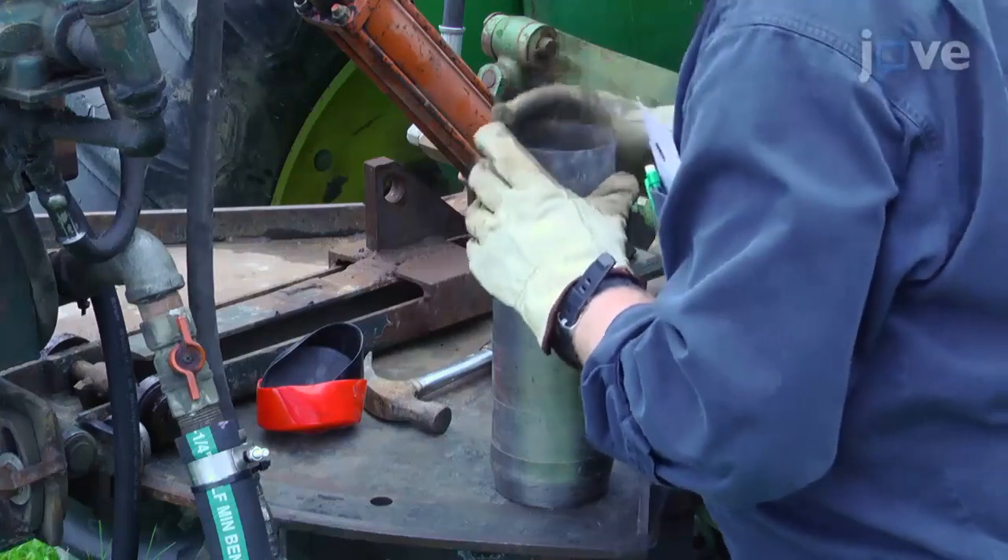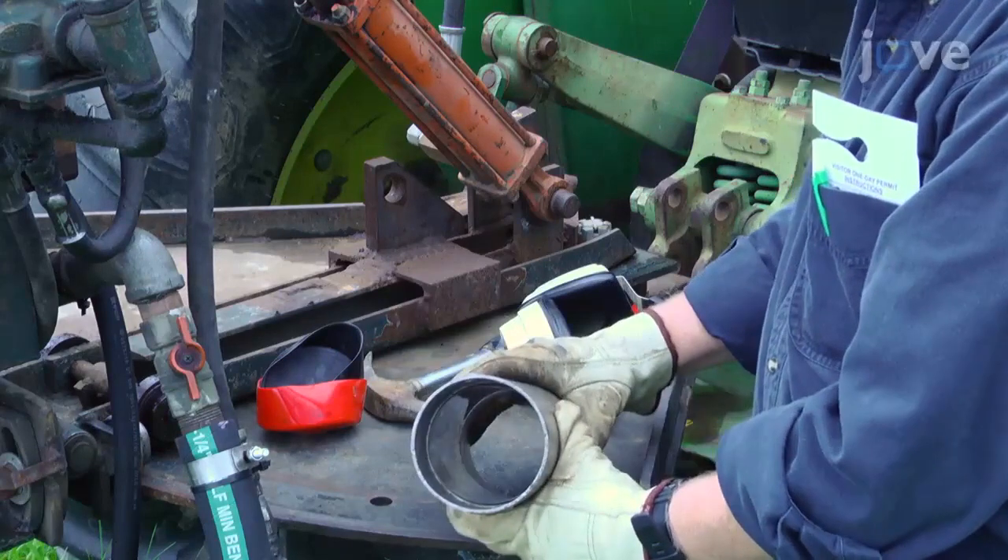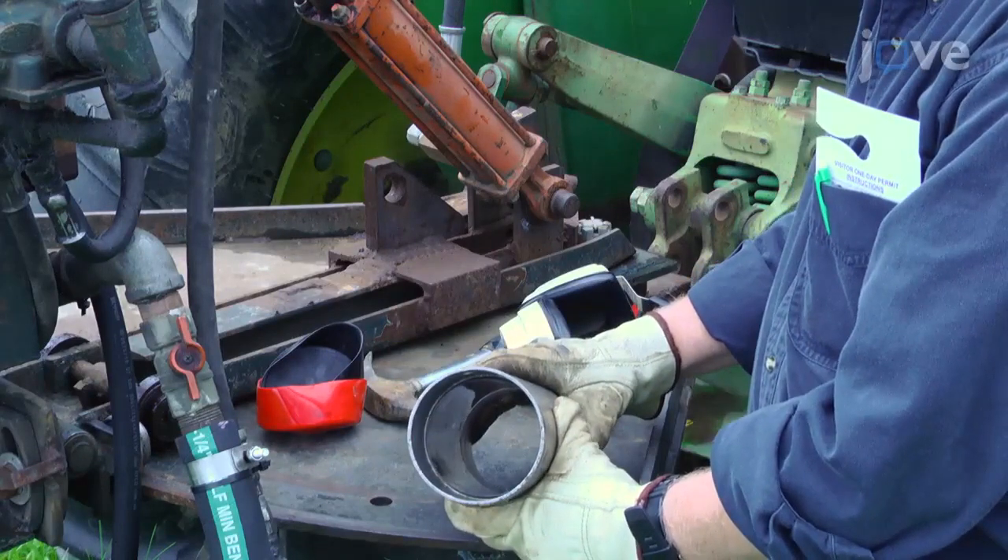For the application described here, use a 150 mm long plastic liner with a 90 mm outside diameter fitted into a 200 mm long metal sample tube with a 100 mm outside diameter and 90 mm inside diameter.